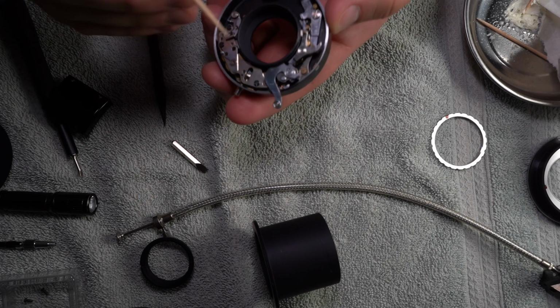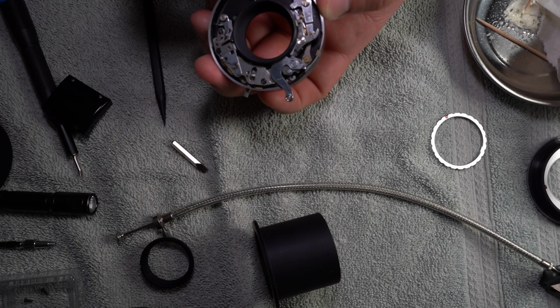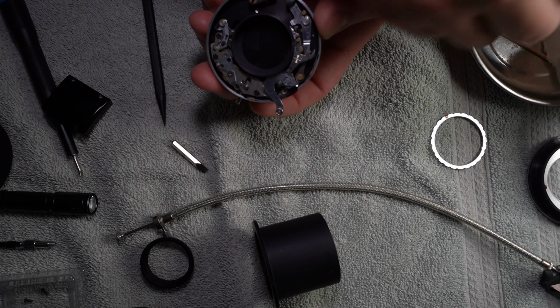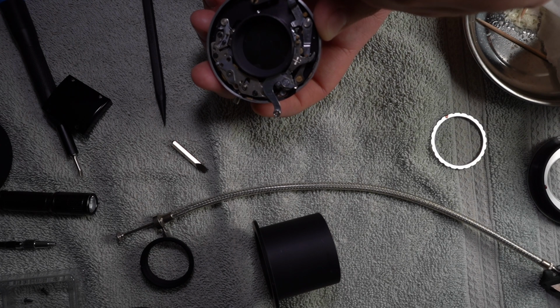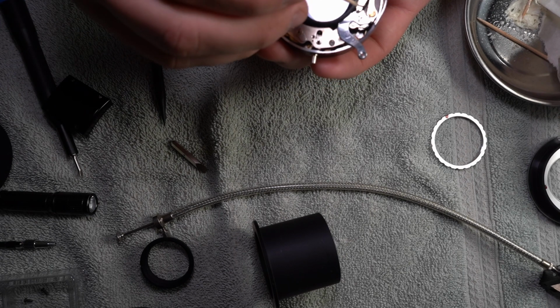Okay, and so I just greased this part in here. And activate this again so I can get to the next part. Got way too much grease that time. And already that point is kind of bent over, but I think it'll work.